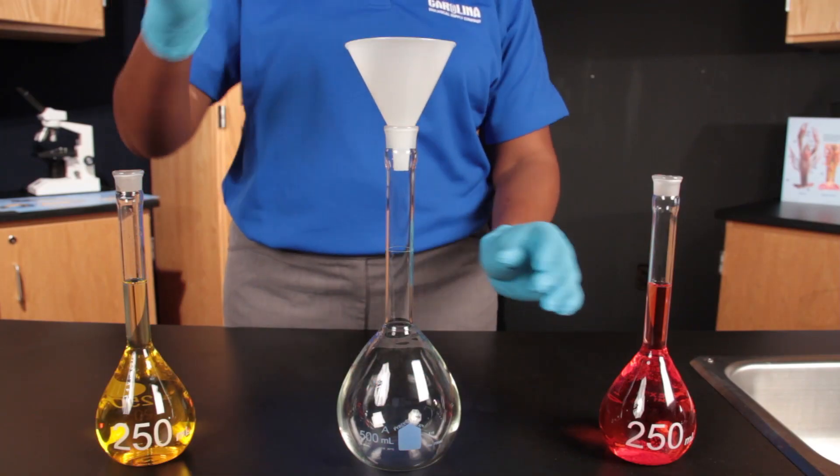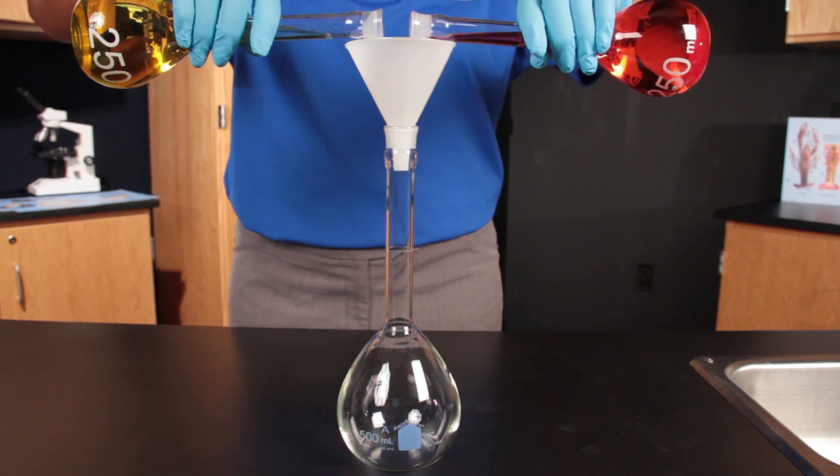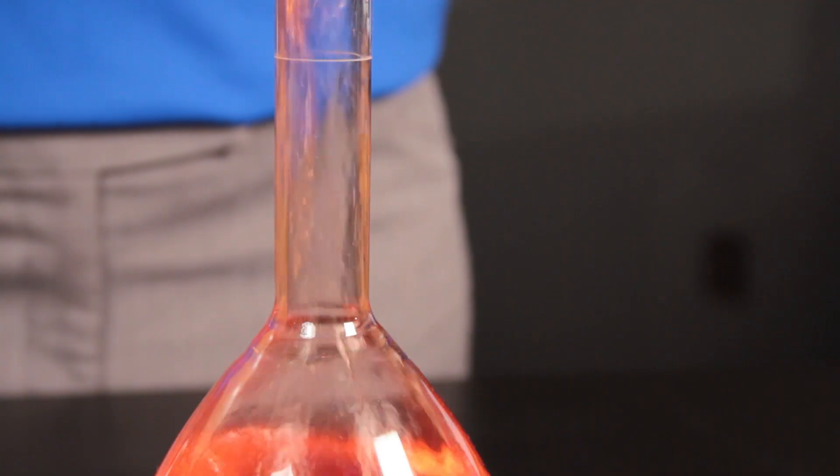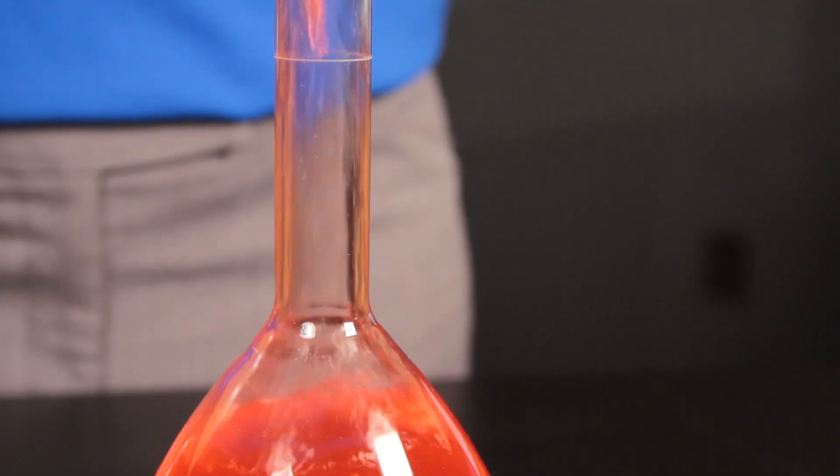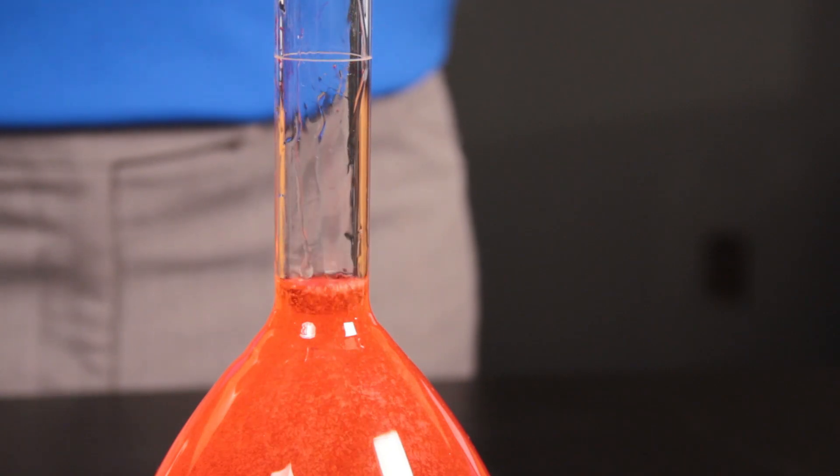Now using the funnel, combine the two solutions in the 500 milliliter flask. Once the two 250 milliliter solutions are added, you will notice that the new volume does not equal 500 milliliters.